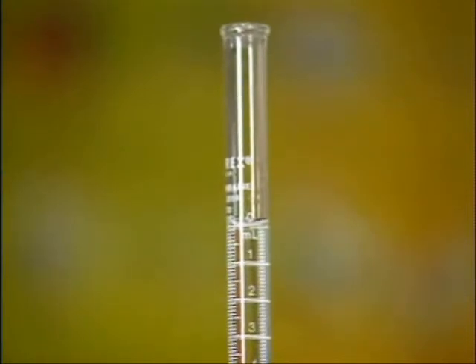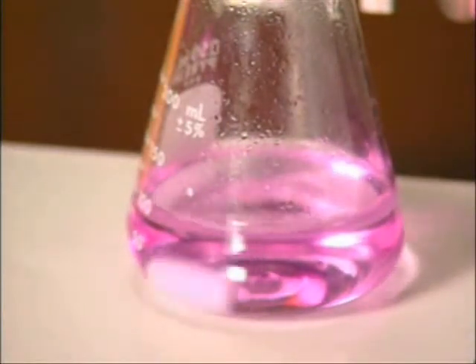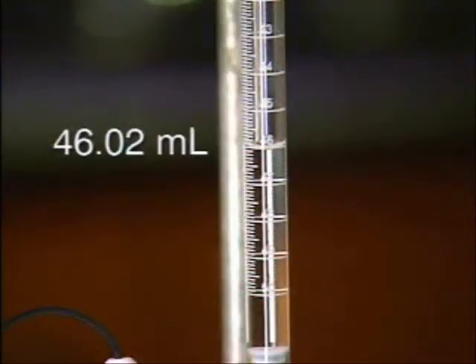The base is added to the acidic solution until the solution stays a slightly pink color. At this endpoint, a final reading is taken. The moles of base added equal the moles of acid present.